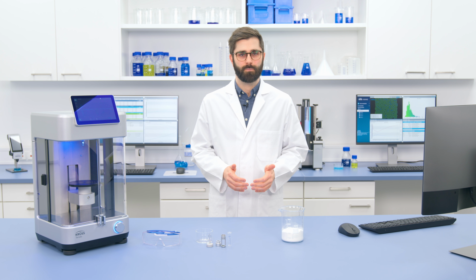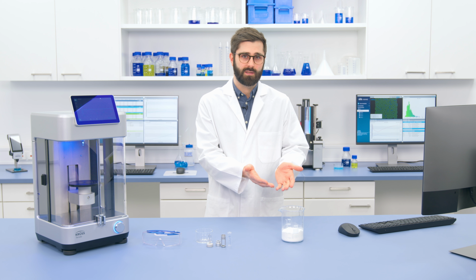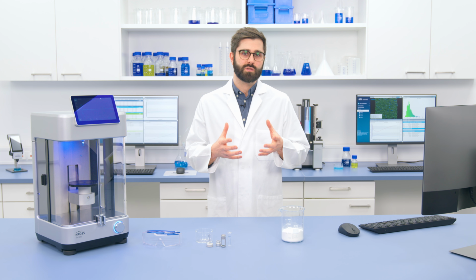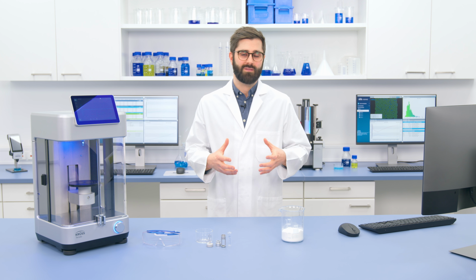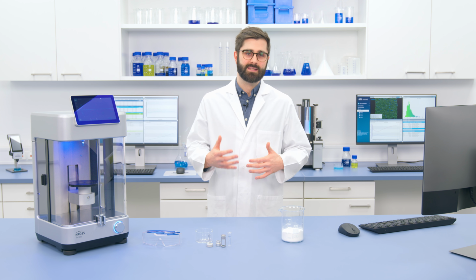In this video, we're measuring the contact angle of a porous material, in this case, a powder. We'll use what's called the Washburn method, and in fact, we'll use a special version of the Washburn method called Washburn Direct, which KRÜSS has developed. And this is a simpler and easier to evaluate method than the classical, and it gives more reliable and user-independent results.